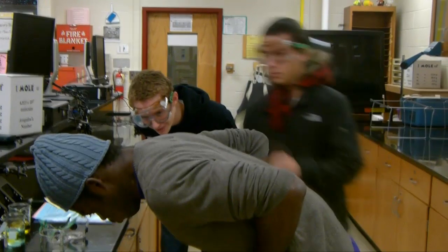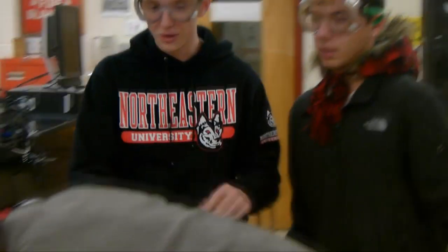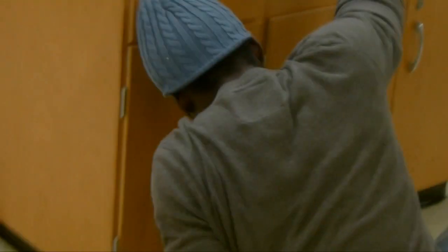Humphrey. Yo, are you about to throw up? Did you swallow it? Are you alright? Spit it out. Yo, just go to the sink. Go to the sink. Humphrey. Oh my god. Come on, bud. Come on, you got this. Yo, should we get someone? Yeah, call 911. Just call an ambulance.